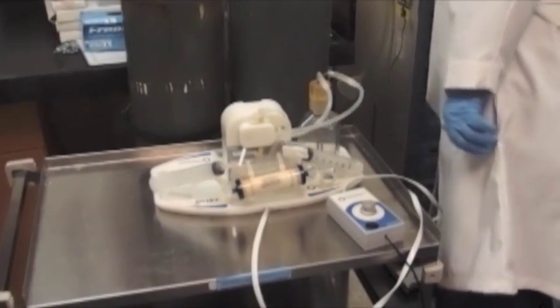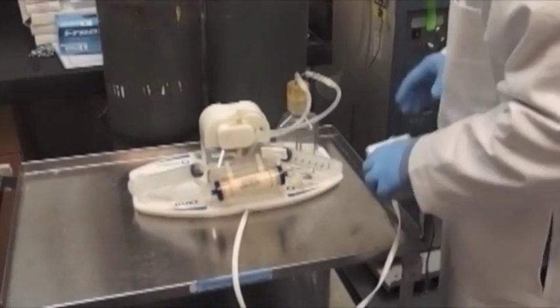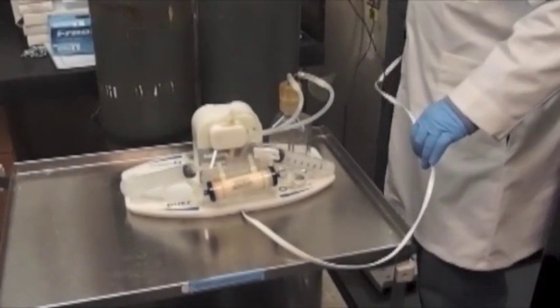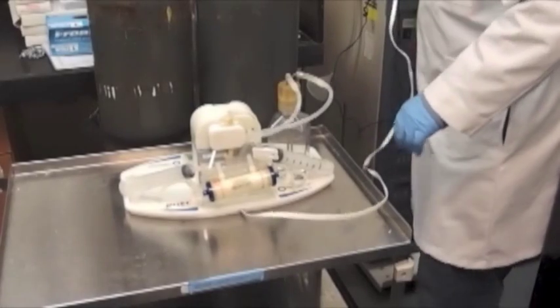There is a thin cord for power that fits through the glass door of the incubator, which helps to maintain the gas composition of the incubator.